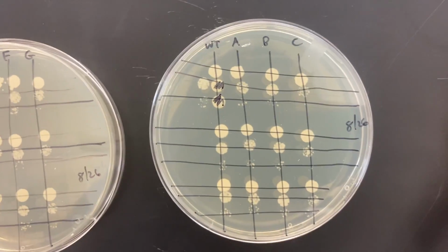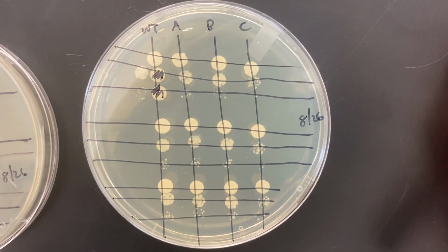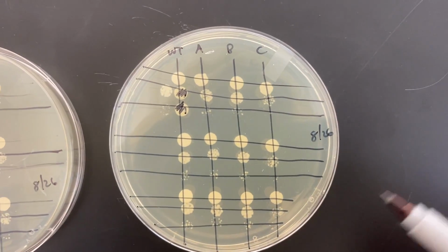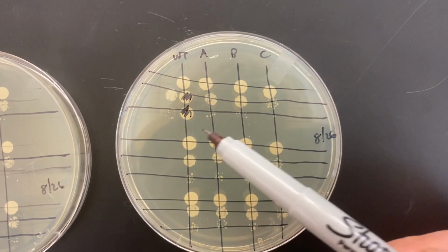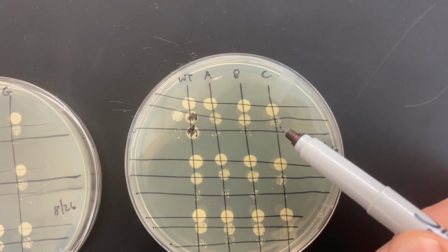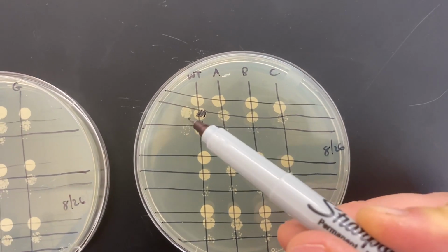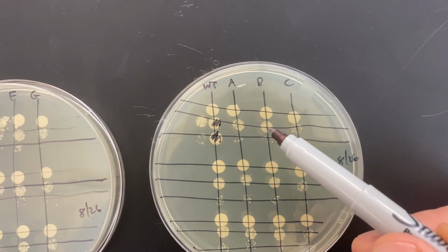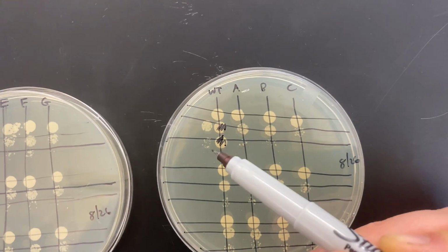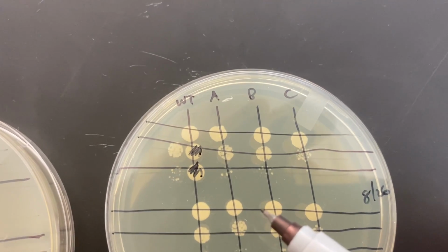But it's good to remember that we did overcome a problem by just dotting them off to the side. Okay, so what we want to compare here is how A, B, and C grow compared to wild type. And probably the best dilution for us here is this middle one, probably for everybody. The middle one, you can still see some light coming through. The most dilute, the 1 to 100 dilution, is, I'd say, too few colonies to really notice.